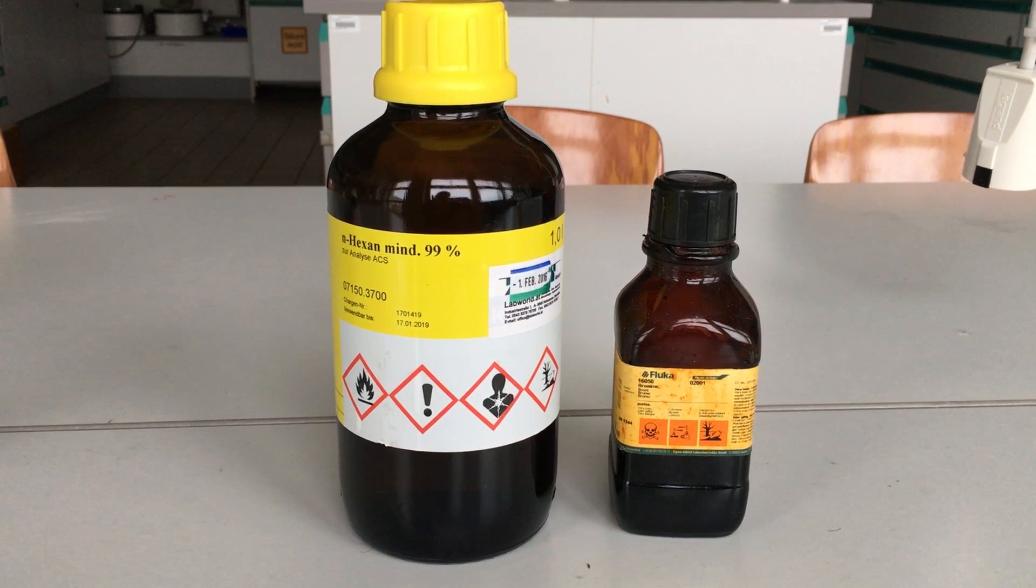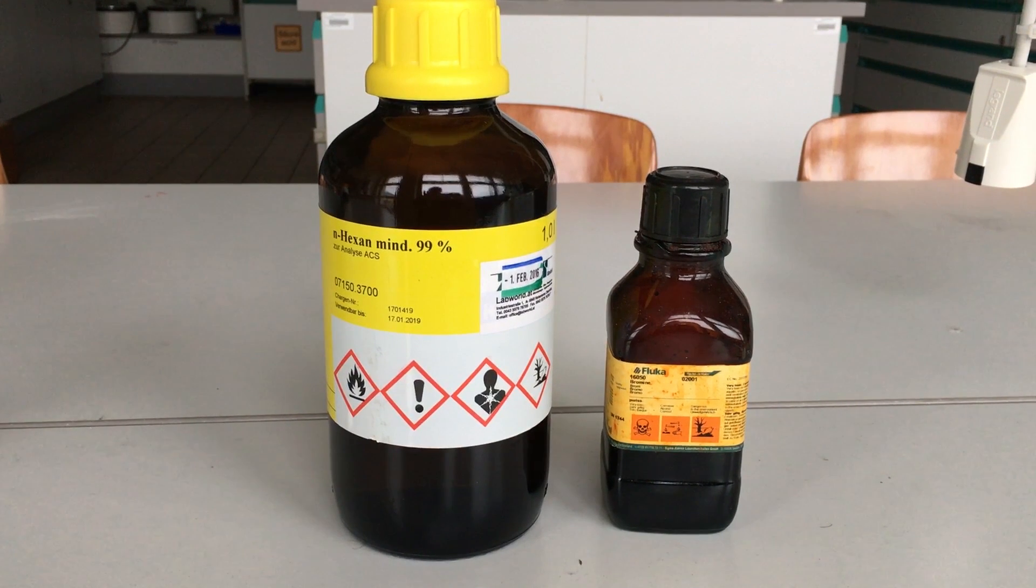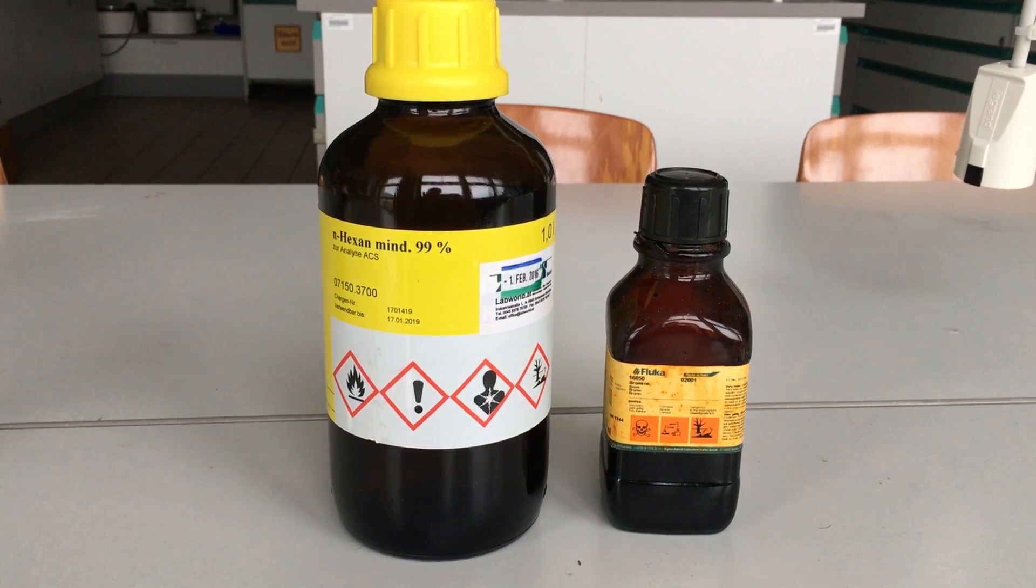Please consider the guidelines concerning the waste disposal which are shown at the end of the video. For this experiment we'll need bromine and hexane.